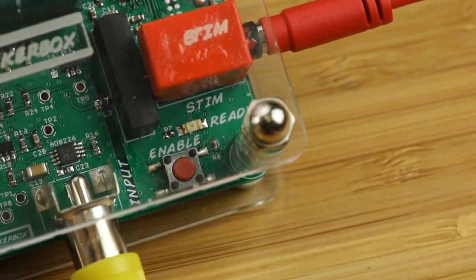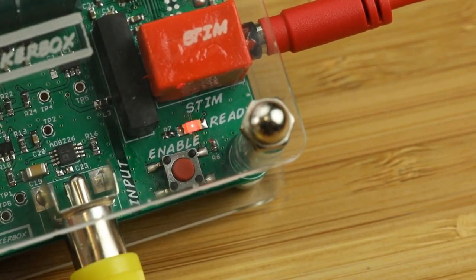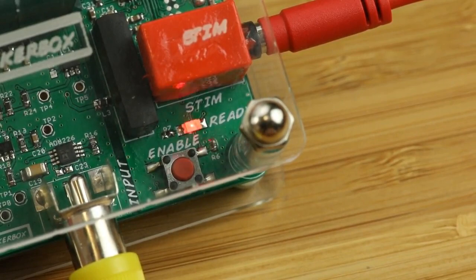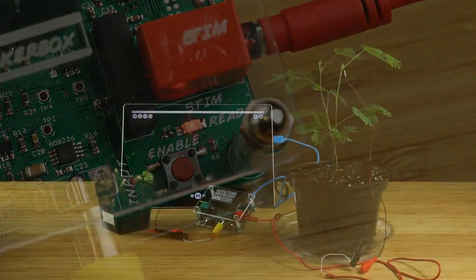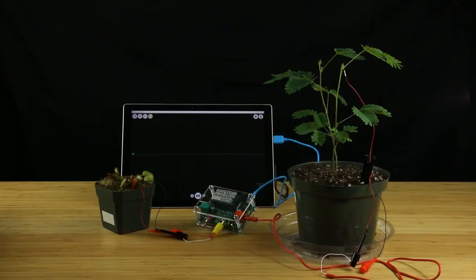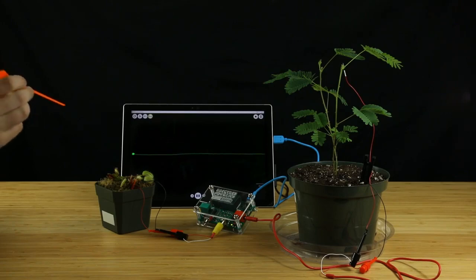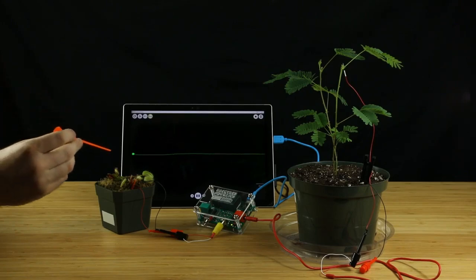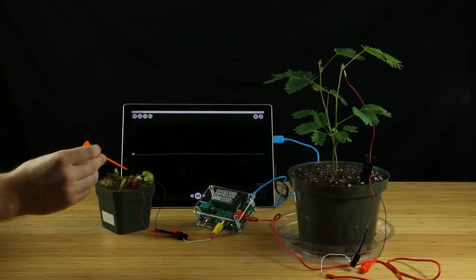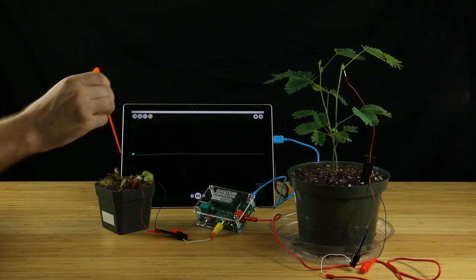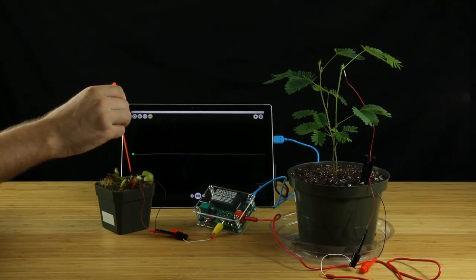Then all that's left for you is to press the enable button and look for the ready LED to begin flashing. At this point, the experiment is armed and ready to go. All you have left to do is to trigger one single trigger hair on the Venus Flytrap plant.